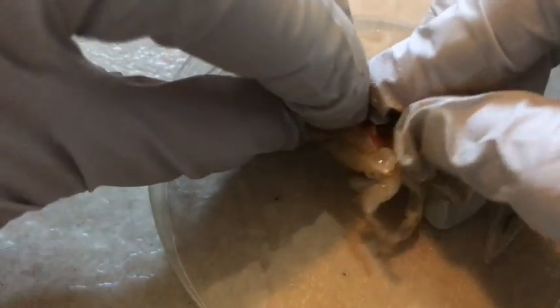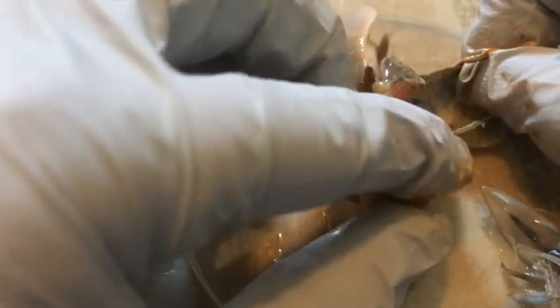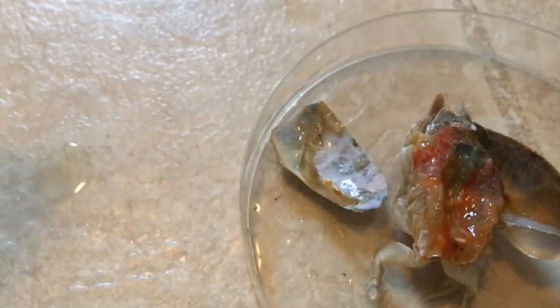In order to do that, we have to pull the carapace up — kind of like butterfly doors on an expensive car. So we're going to pull it off very, very gently. Just pull it up a little bit like that. It's a little gross, I know. I'll move the camera just a little bit.